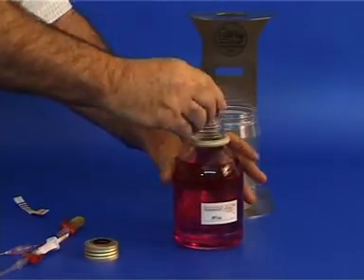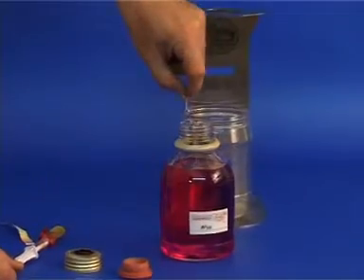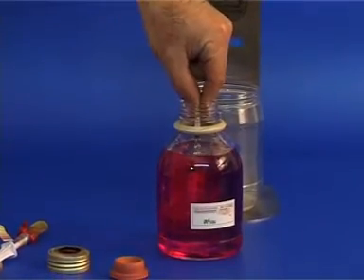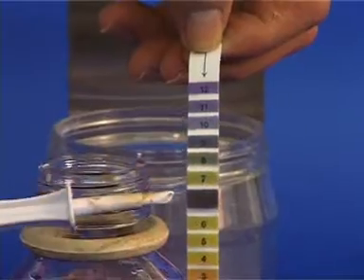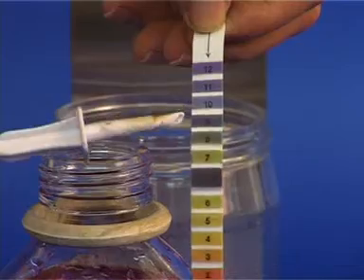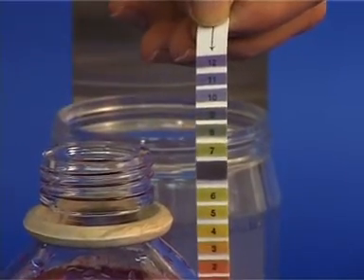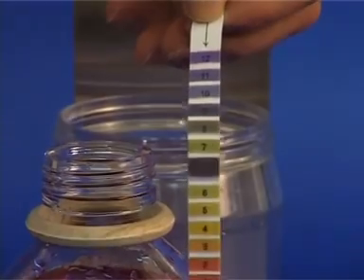Place the pH strip indicator into the bottle and note the color change in the center of the strip. Compare the color that developed in the center to the numbered colors to obtain a pH reading. The reading here is approximately 11, compared to about 7.